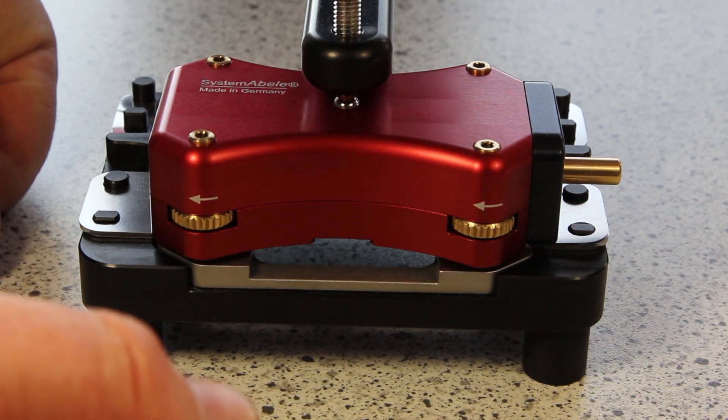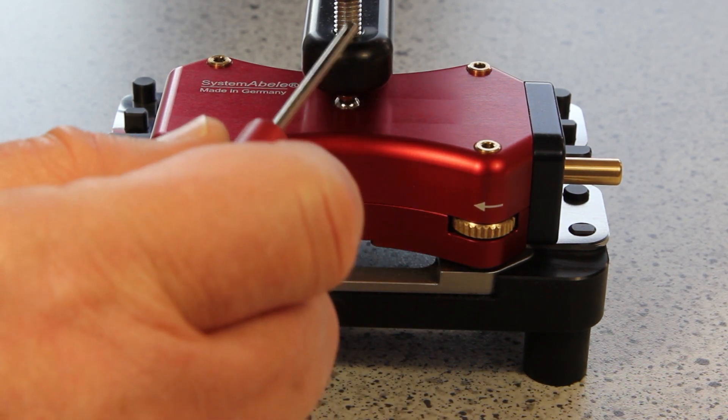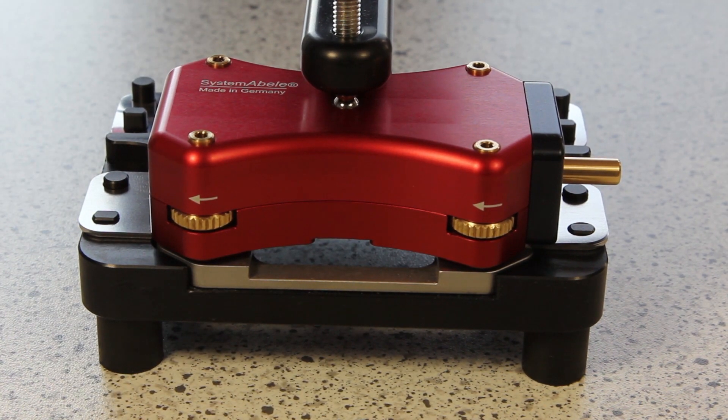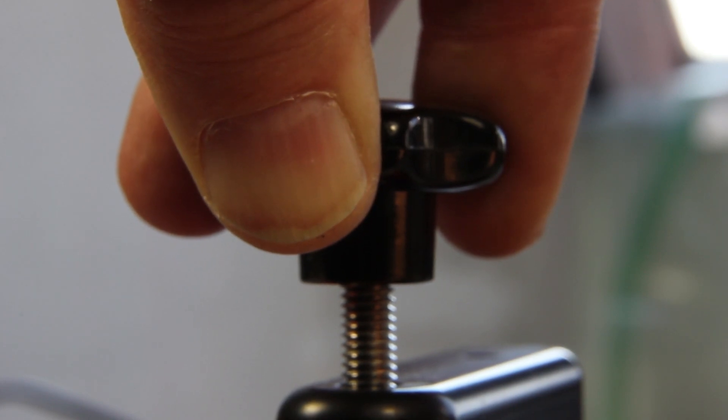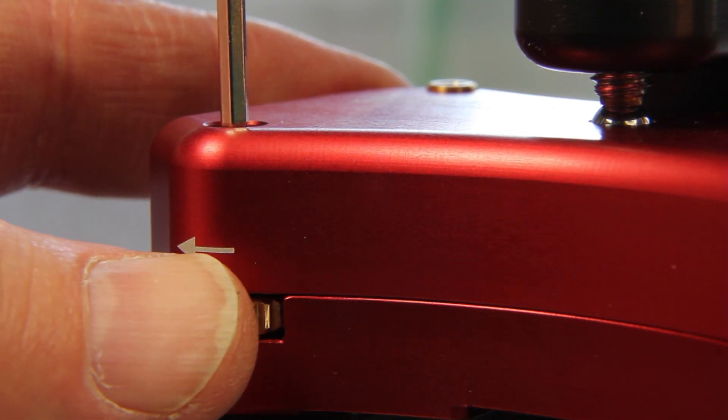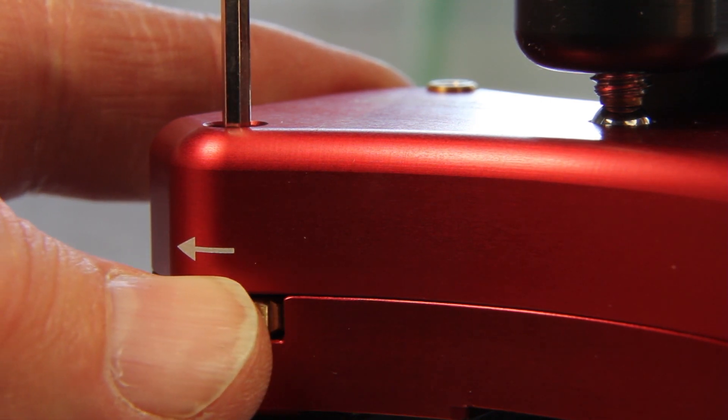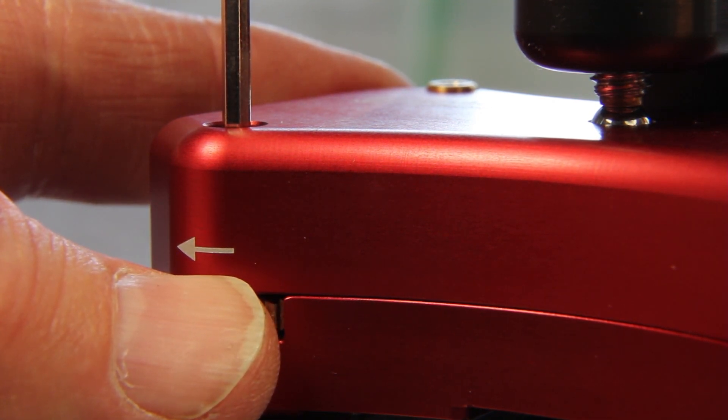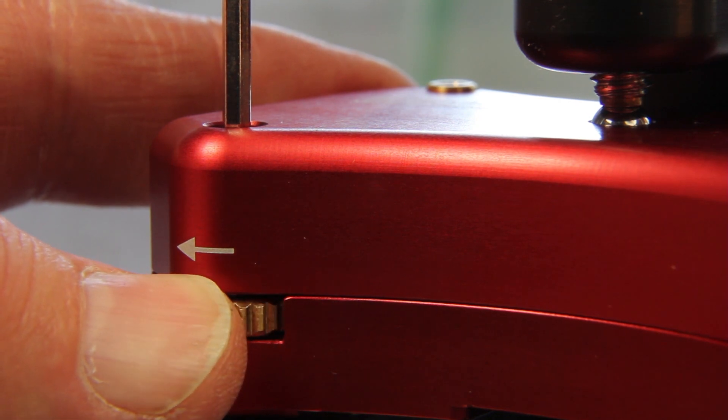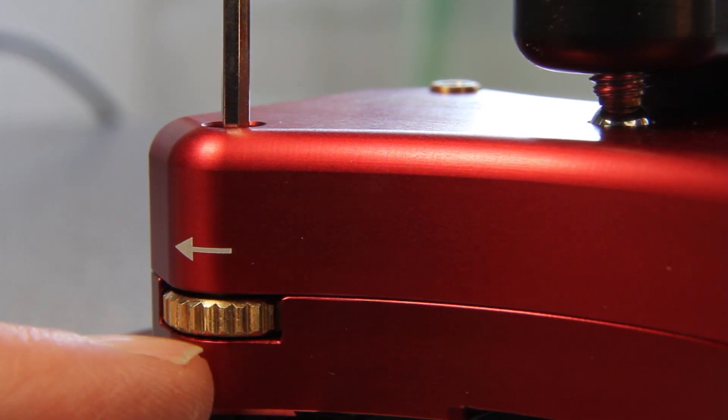The mouse has to be exactly in the middle. The ball has to be here directly under this screw. I tighten this screw as strong as I can with three fingers. Now I turn the foot down, moving at the same time the counter nut. It has to be completely free. When I feel that I am down and the counter nut is free, I turn the foot as strong as I can with two fingers. Only with two fingers. I hold it and at the same time I counter the counter nut in the direction of this arrow. It's important.